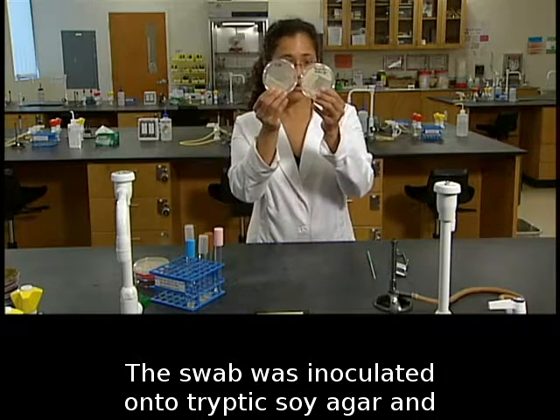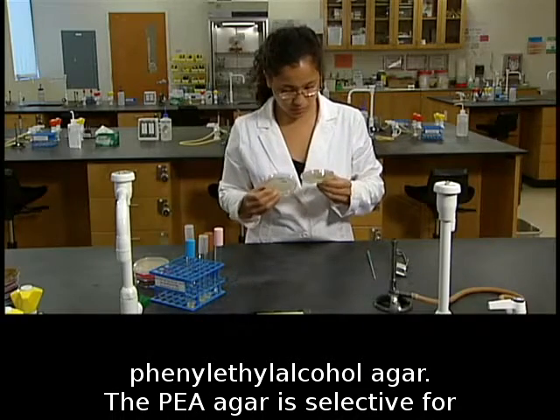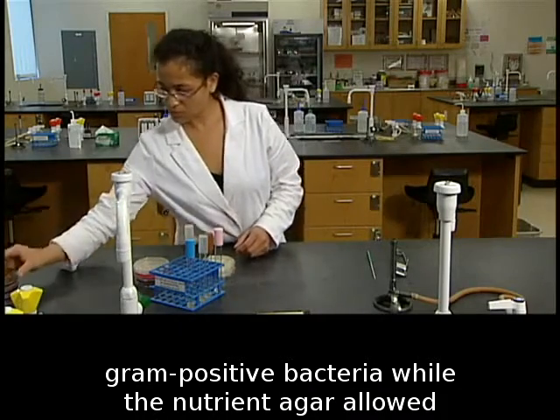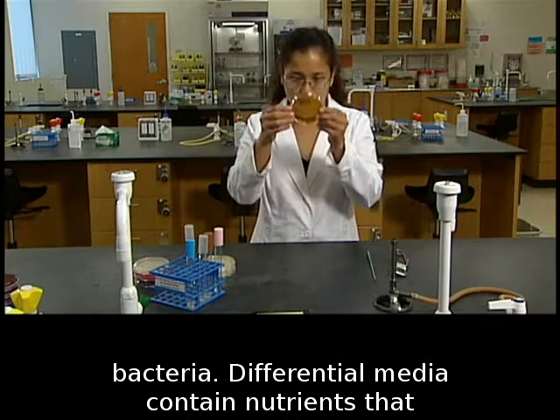The swab was inoculated onto tryptic soy agar and phenylethyl alcohol agar. The PEA agar is selective for gram-positive bacteria, while the nutrient agar allowed growth of both gram-positive and gram-negative bacteria.